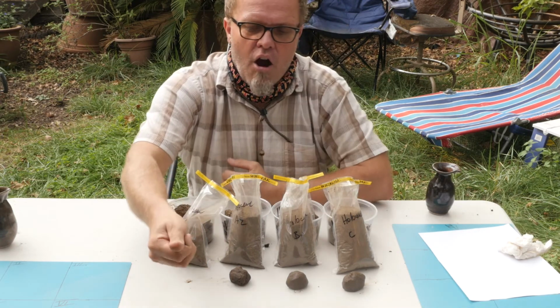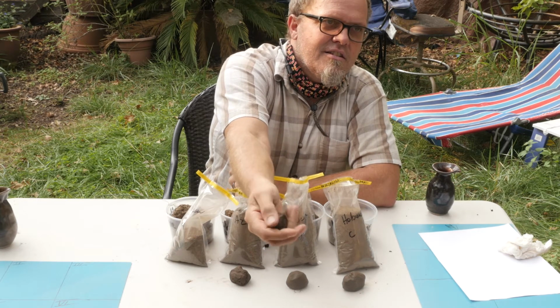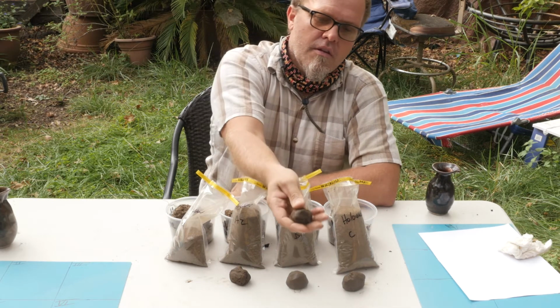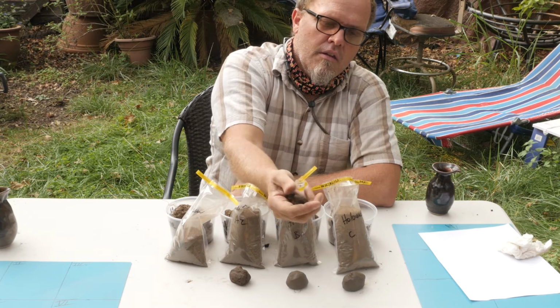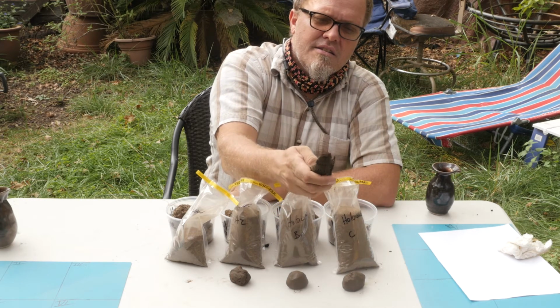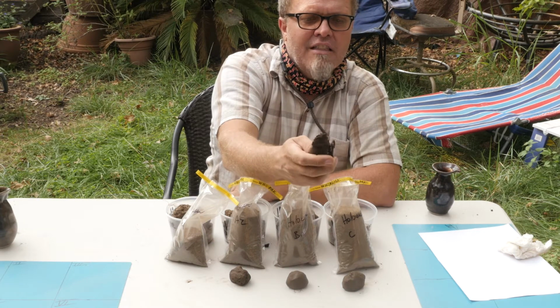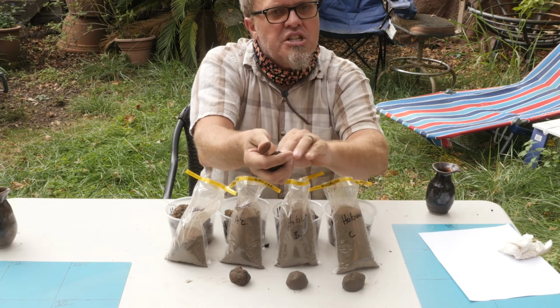So we have our first ball. If I squeeze it, does it remain a ball? Yes. So what's the next step? Place a ball of soil between thumb and forefinger, gently pushing the soil with the thumb, squeezing it upward into a ribbon. So the next step is, does the soil form a ribbon? And it does, slightly. That's about as far as it'll go. I have to hold it up. That's about 2.5 centimeters. If I let go of it, it'll fall off and break into that piece. So it will make a ribbon, but just not a very big one.